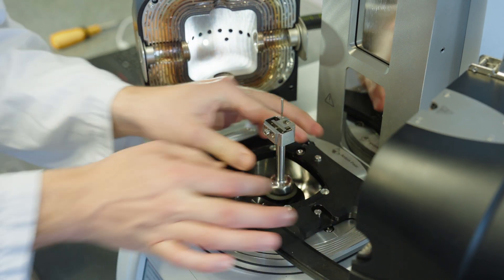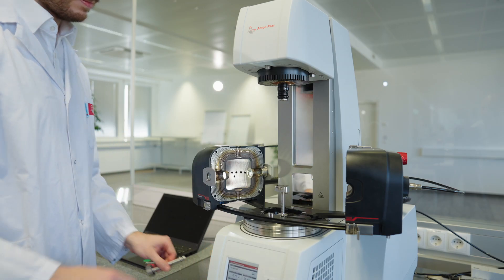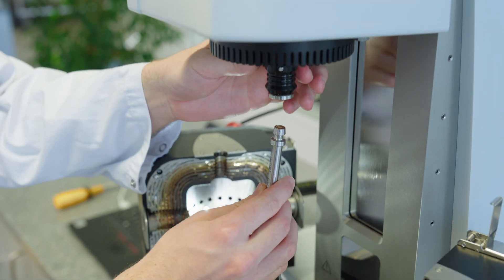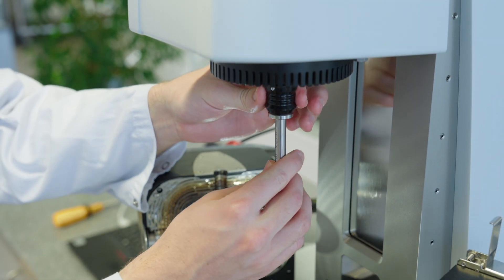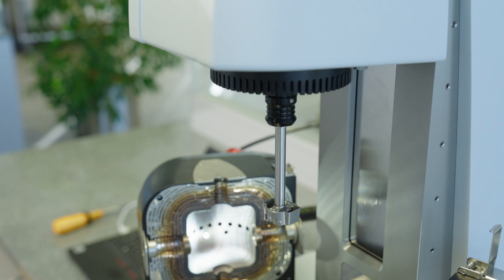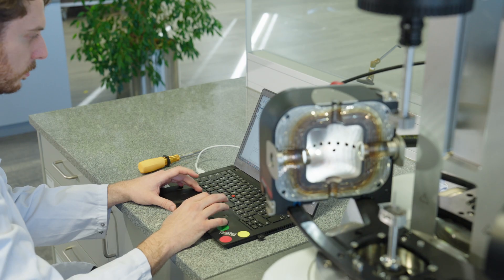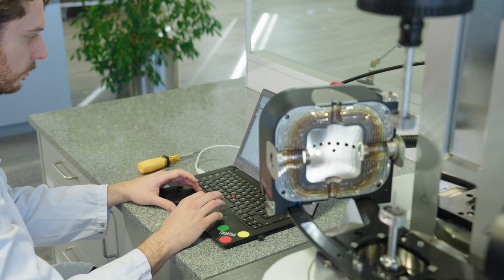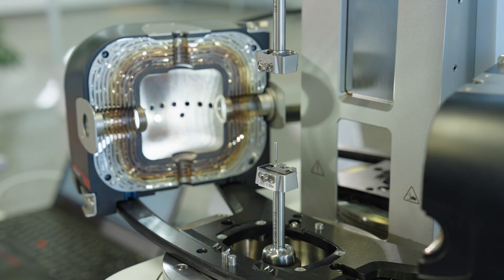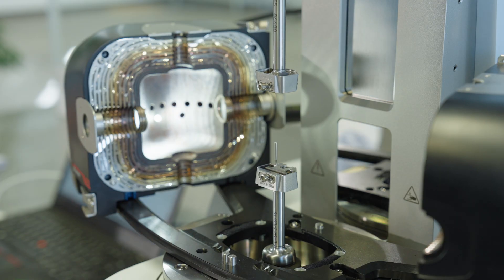Additionally, DMA instruments are used for tensile tests and thermomechanical analysis to determine the thermal expansion of a sample. For this study, we will perform a temperature ramp in tension on a separator material and a tensile test on a current collector material.